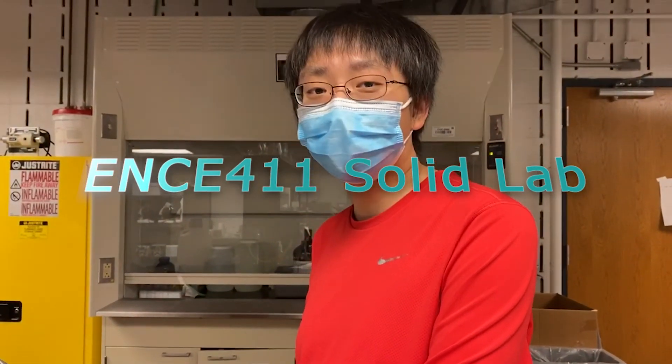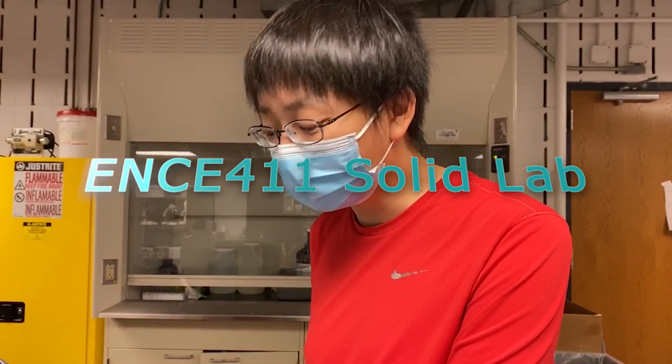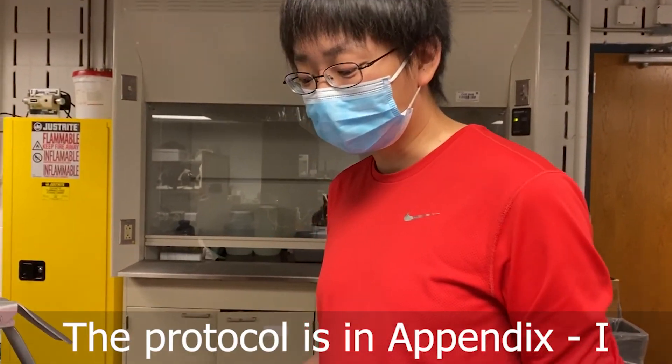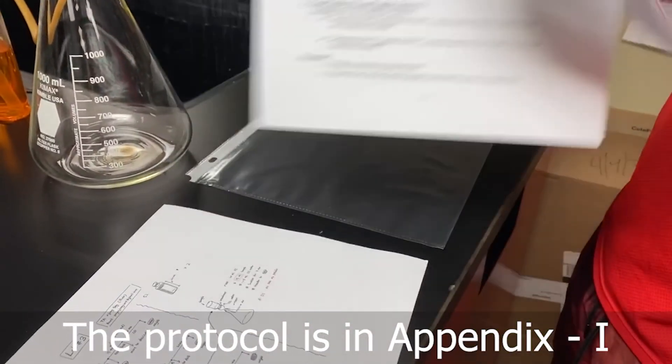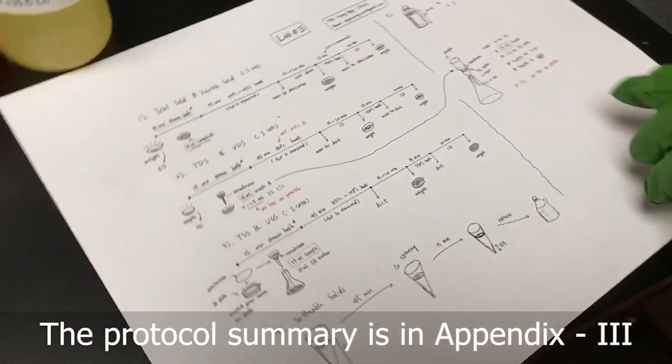Hello everyone, this is Reva, and today we are going to do the solid lab. Before the experiments, you guys have already read the protocols, and here is a summary of the protocols.